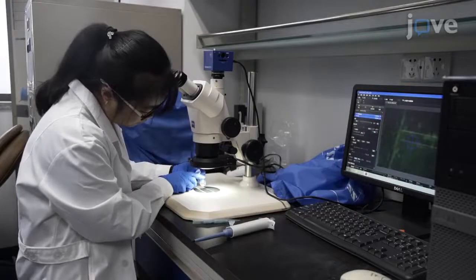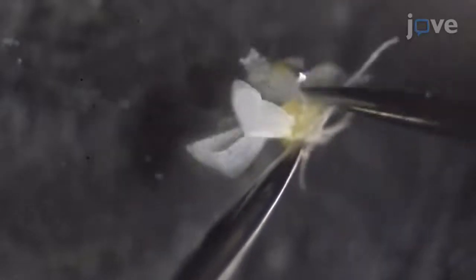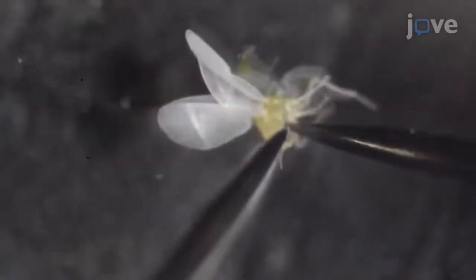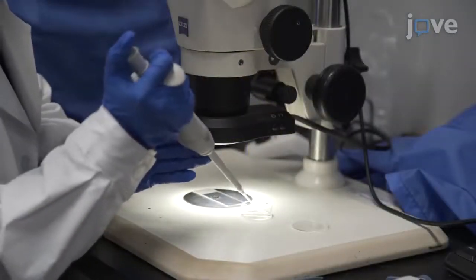At the appropriate experimental time point after virus acquisition, place ice-anesthetized female whiteflies into a drop of PBS on a microscope slide and use a fine acupuncture needle to open the abdomen of the whitefly under a stereomicroscope. Use the needle to extract the midgut and place the midgut into a collection dish of PBS.